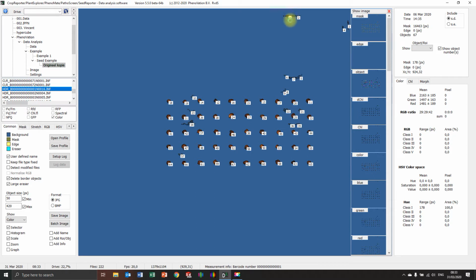And I'm going to look at these levels. So this is level 1. Object 1 is 178 pixels. I don't think, because these are also small. 183. I think this was the smallest one, 83. 195, yeah. Let's put this on 90-ish.